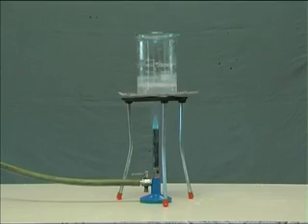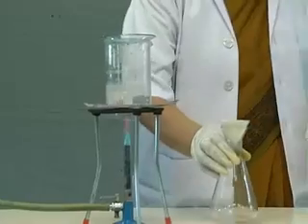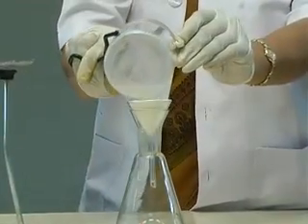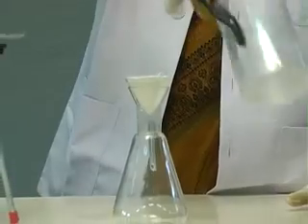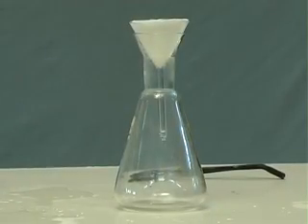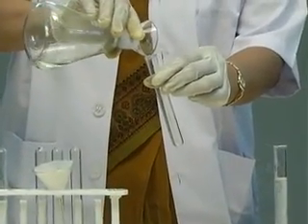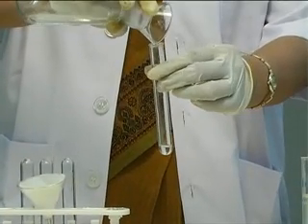Scales and precipitates formed by the boiling of hard water are separated from water by filtration. Once filtered, you will notice that the water is soft — that is, it contains very little calcium and magnesium salts — as shown by the addition of sodium carbonate to boiled and filtered water. You see the solution is very nearly clear.